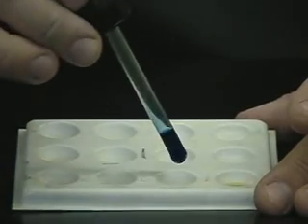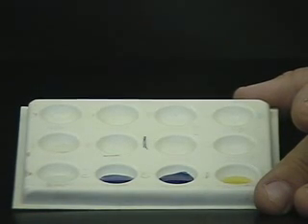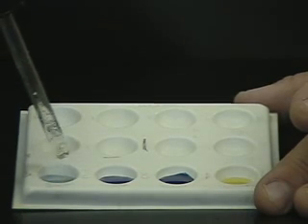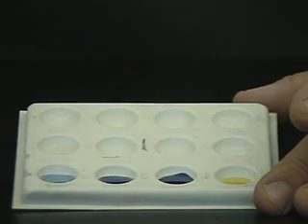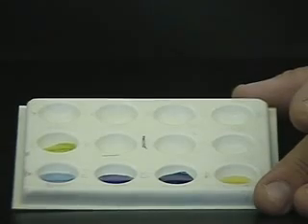Indicator 1 in the base shows a yellow color. Indicator 2 in a base shows blue. Indicator 3 shows blue. Indicator 4 also shows a light blue. And lastly, indicator 5 in the presence of a base shows a nice yellow color.